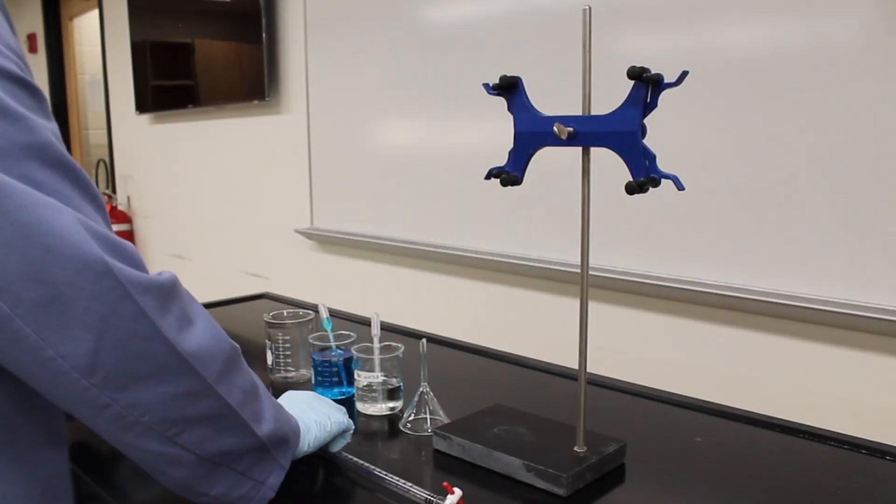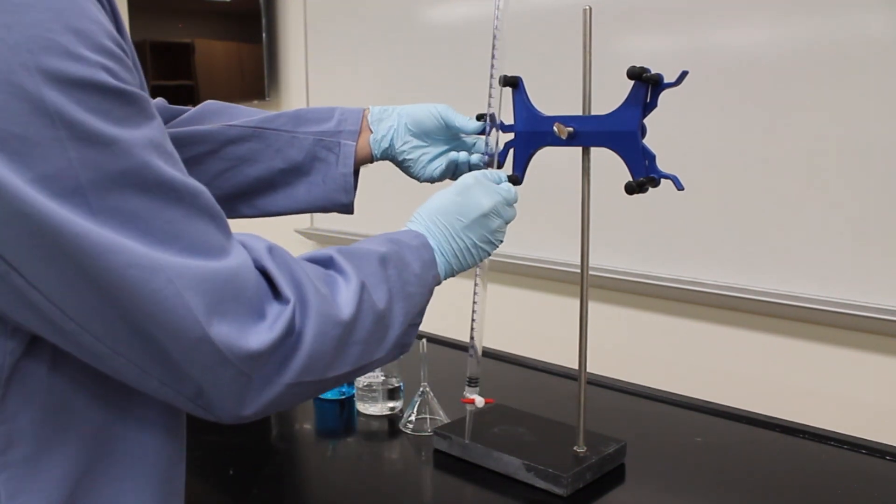The first thing that you always want to do is to clean your burette to ensure that there are no impurities inside. Take your burette and mount it in the stand.